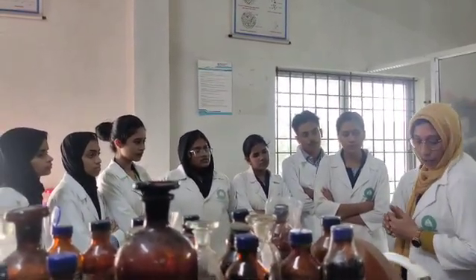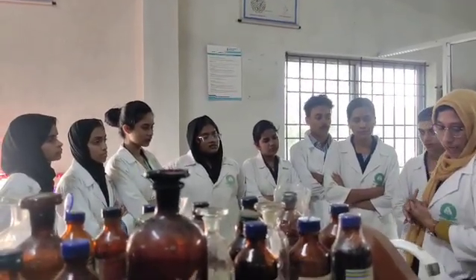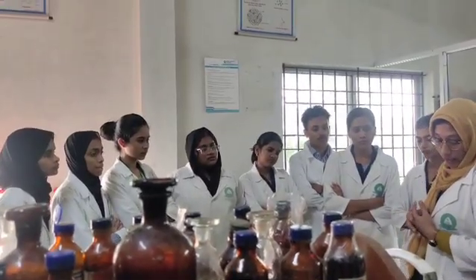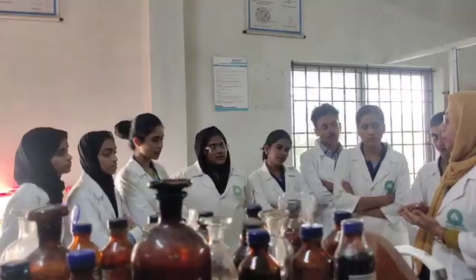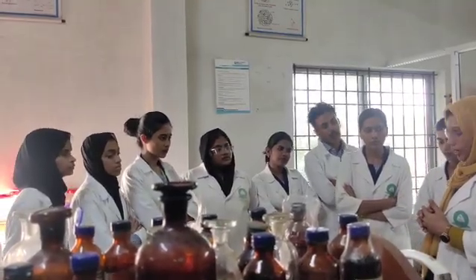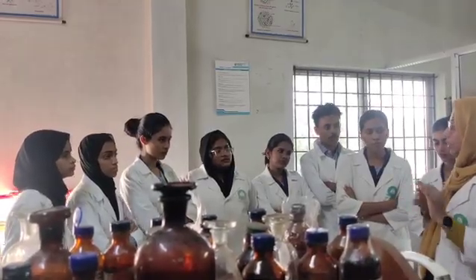Then for agar we have a specific test, the test for sulfate. To the aqueous solution of agar, add equal volume of dilute hydrochloric acid, then treat on a water bath for 30 minutes, then add barium chloride solution. What will be the observation? A white precipitate is formed. That white precipitate indicates the presence of sulfate, which is the specific test for agar.